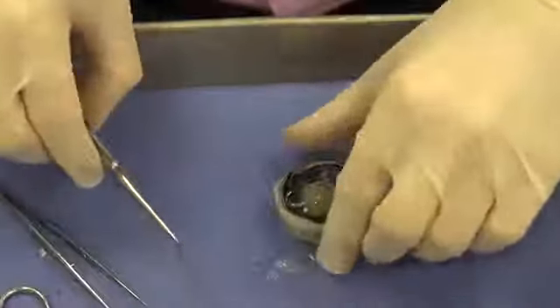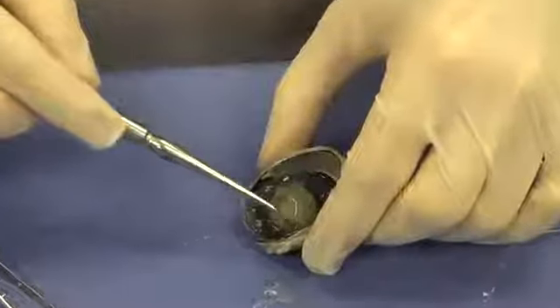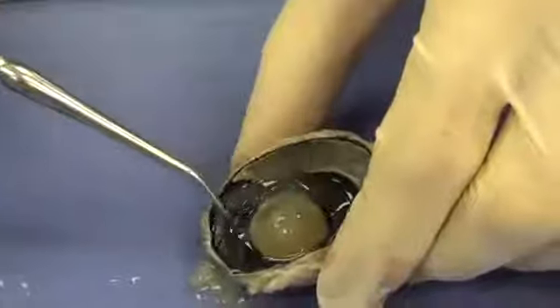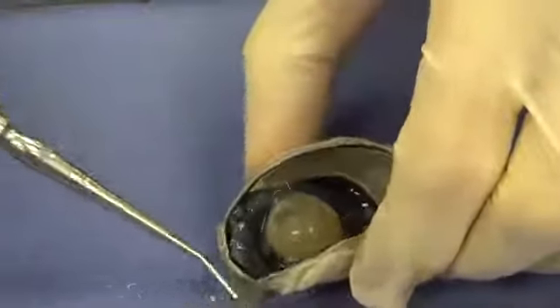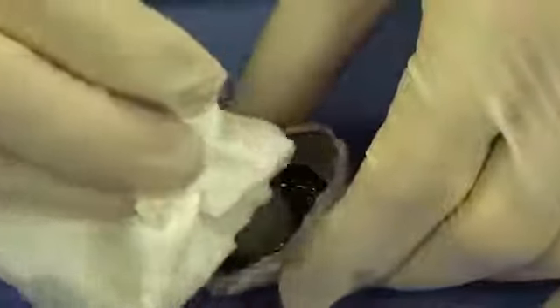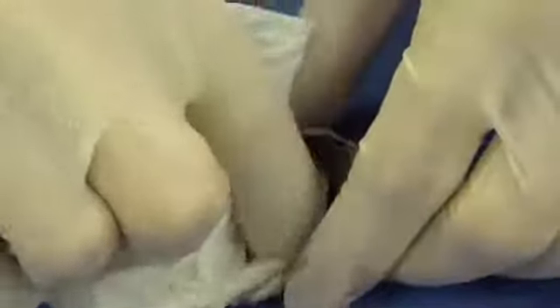And again, I want to remove some of that excess vitreous humor. So I'm going to remove some of that very gently. Don't want to disturb the other structures of the eye. So very gently I'm going to remove some of that vitreous humor. And I'm going to take the paper towel and just very gently dab it a little bit so we can see clearly in there. You can see all that jelly-like material.